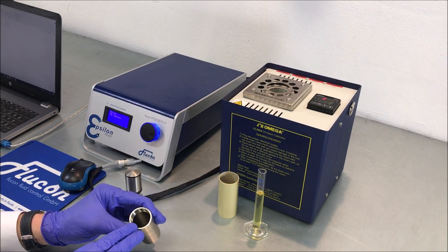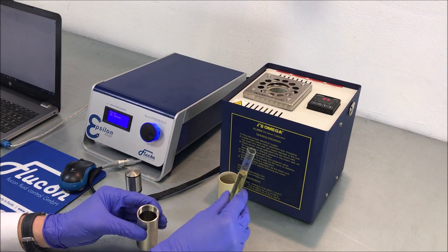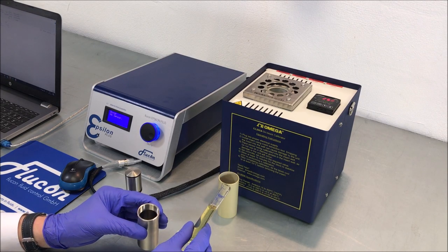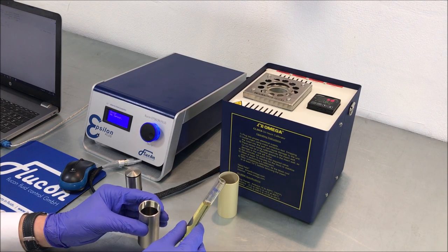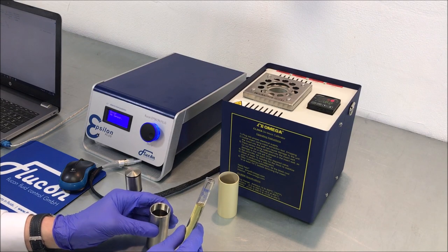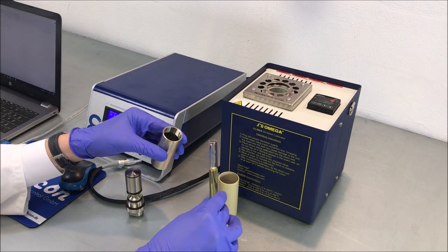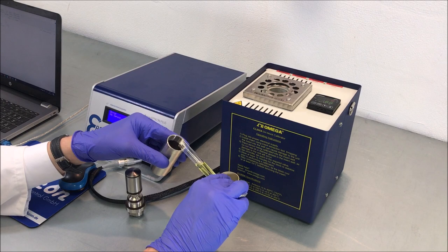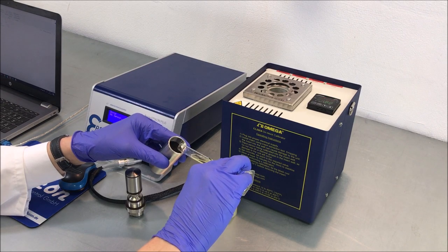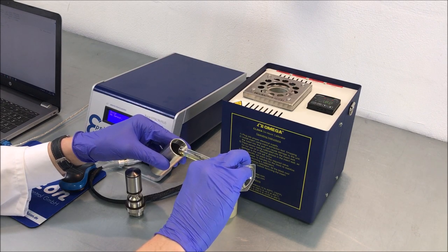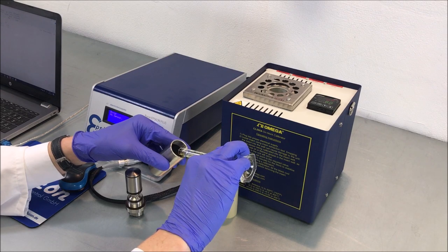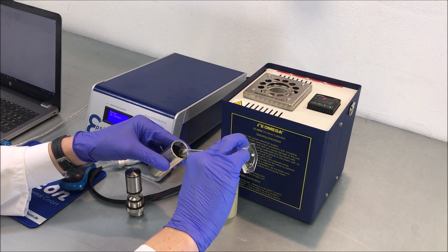Now grab the cup and fill it with eight milliliters of your sample. Pour your fluid slowly from the glass cylinder in order to avoid any entrained air in your sample.